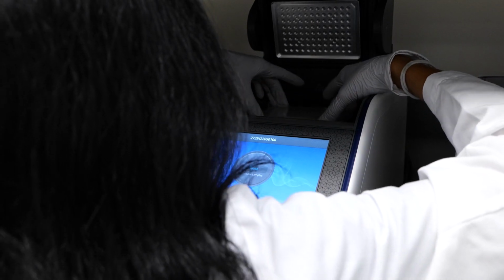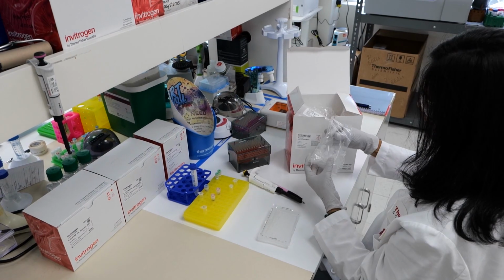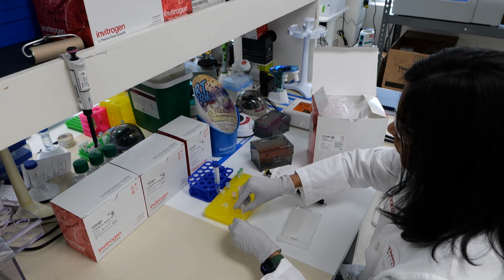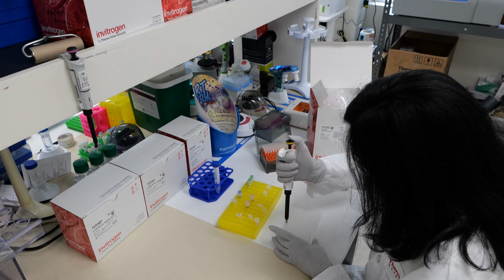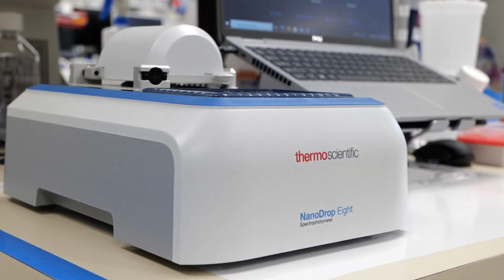This involves PCR amplification and annealing the respective forward and reverse donor arm primers for each gRNA using the reagents included in the TrueTag kit. After the PCR reaction, clean up your PCR product with the included reagents and measure the concentration of your DNA via nanodrop or qubit assay.